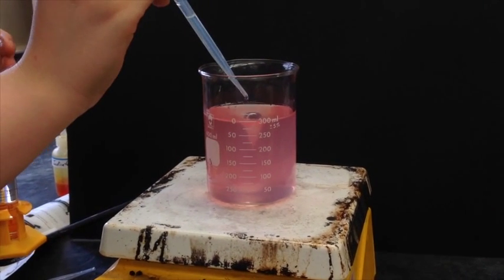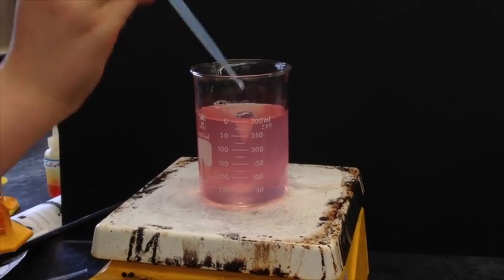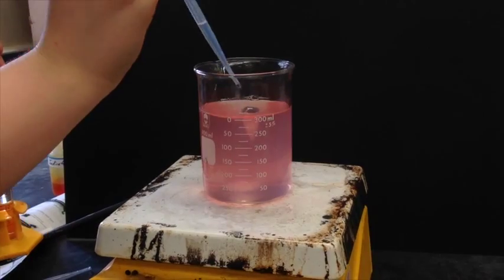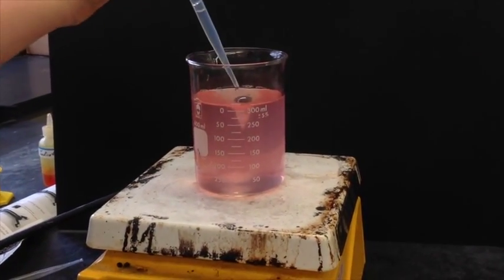We're now adding NaOH instead of HCl, making the solution, instead of acidic, basic, or back to basic. And you'll see the color change happen oppositely.